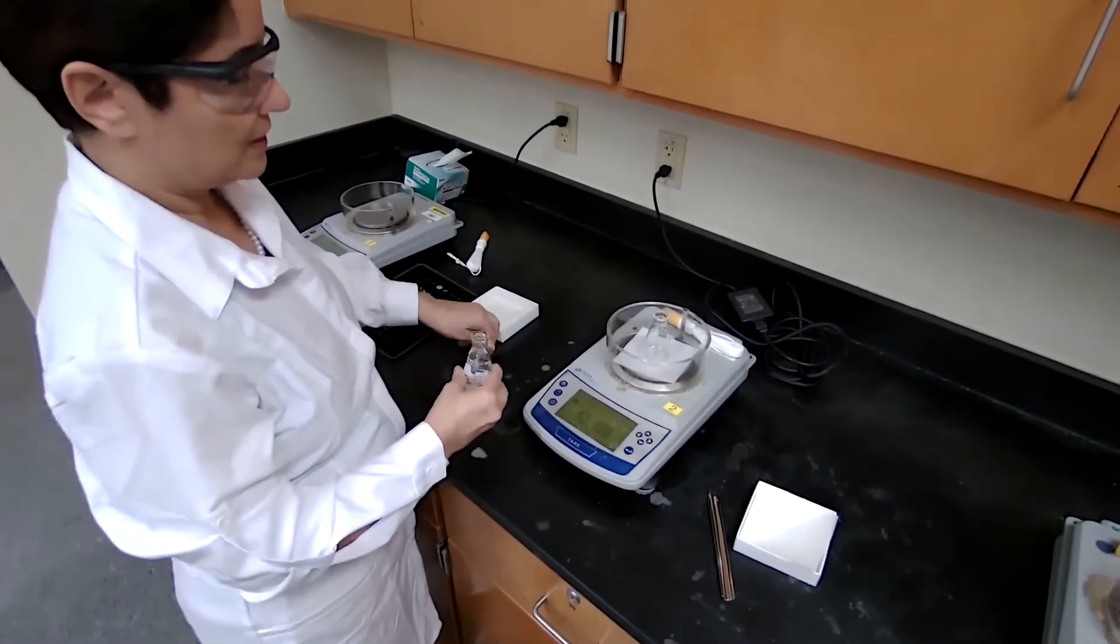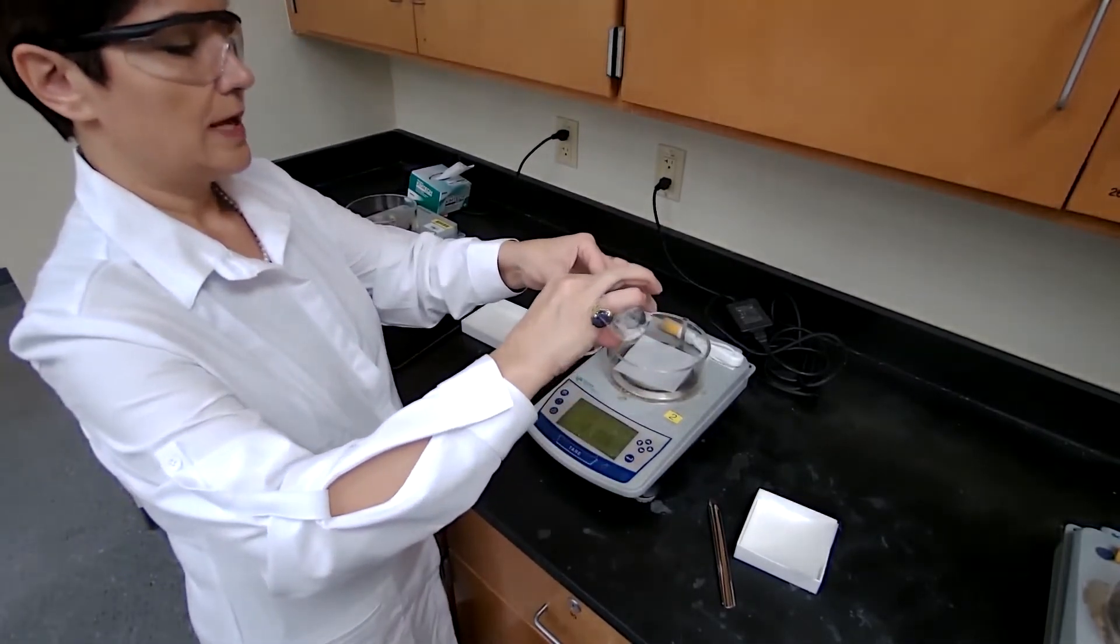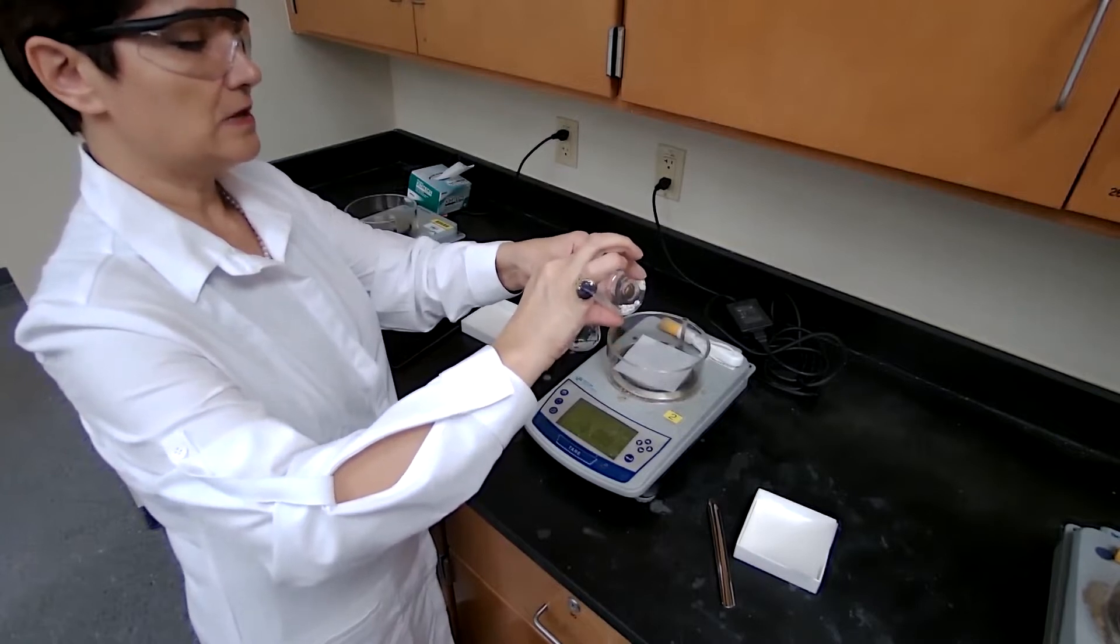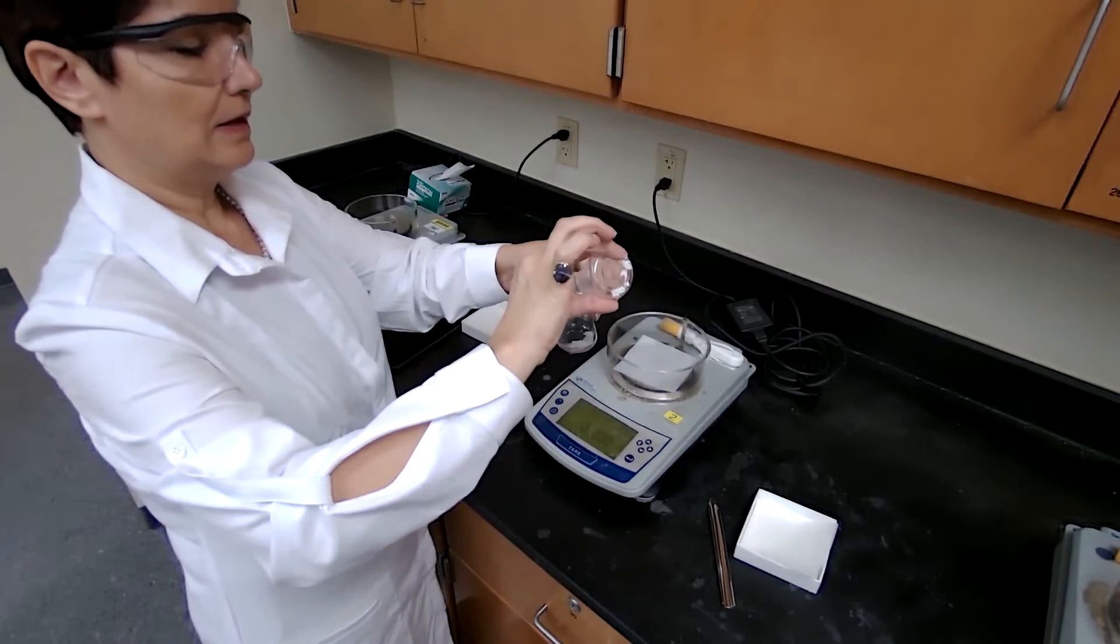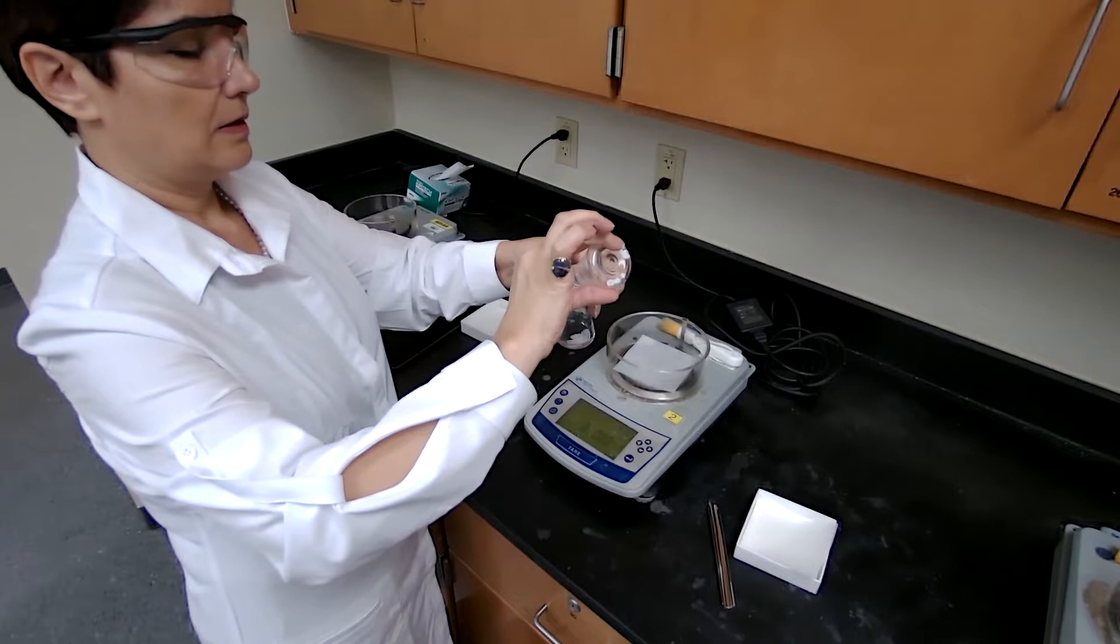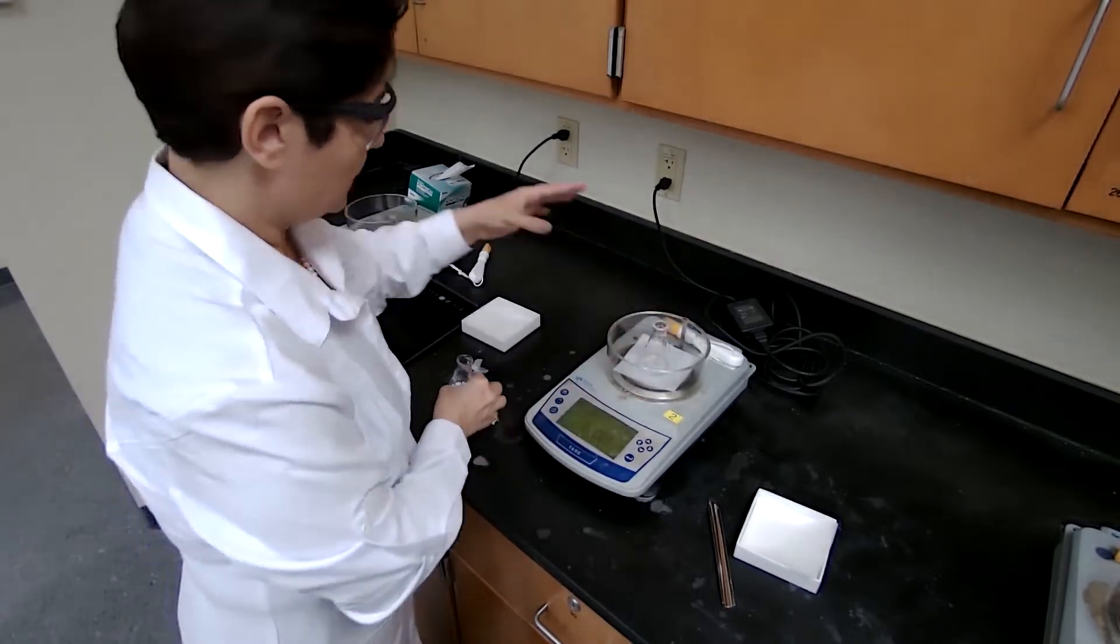I would transfer the organic layer into the empty container without getting any solid in. This is called decanting. And measure the mass again.